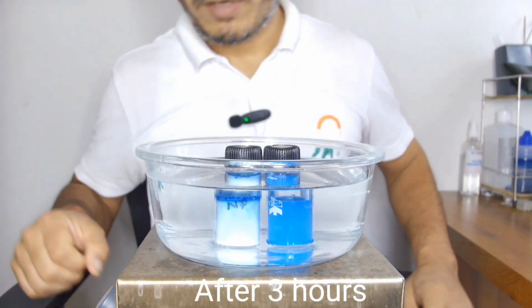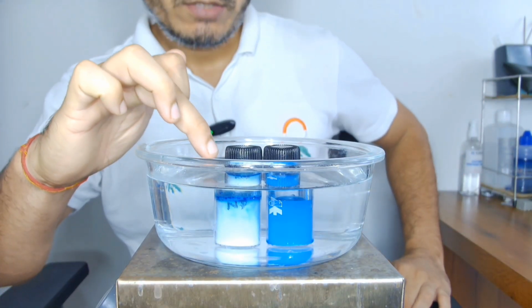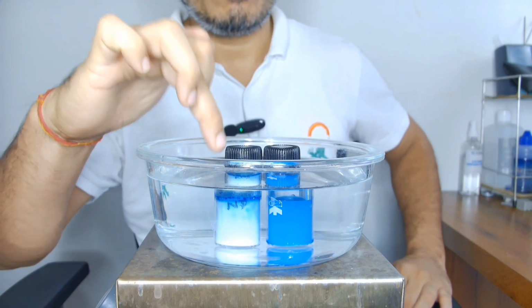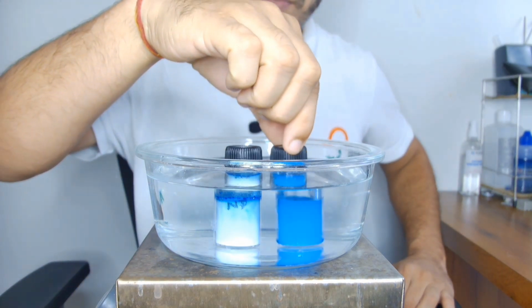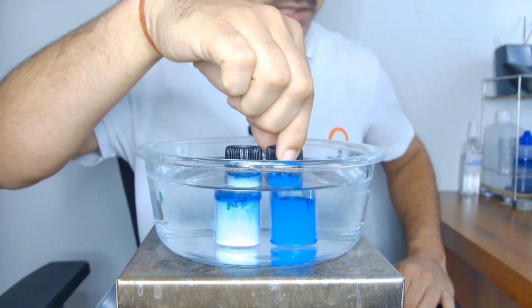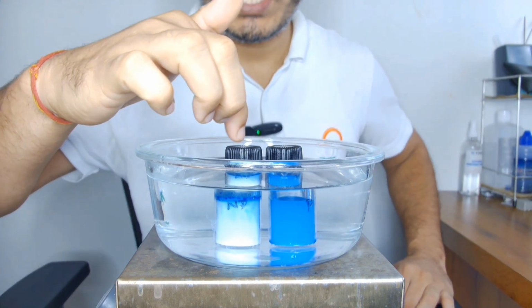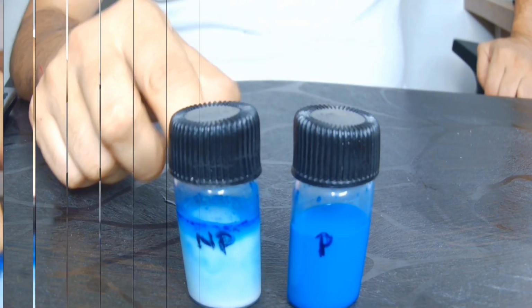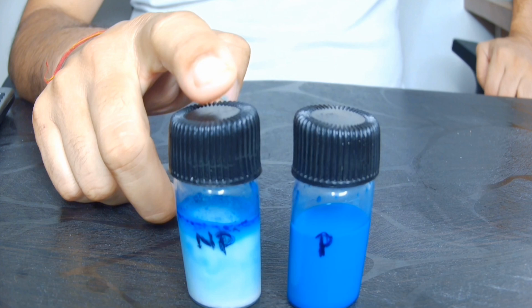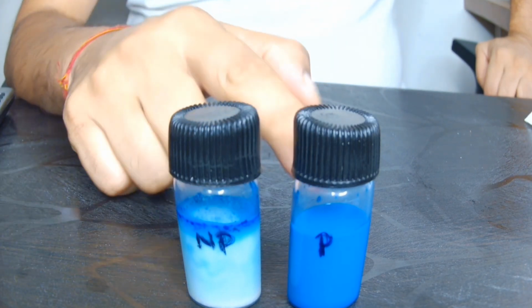Now after 3 hours, you can see the color has changed in this one, which is non-pasteurized, which we have taken loose from the local dairy. And this is the bottled one, the pasteurized one, P. You can see the color over here, and in this one the color is decolorized. This one was the non-pasteurized loose sample from the local vendor, and this was pasteurized.